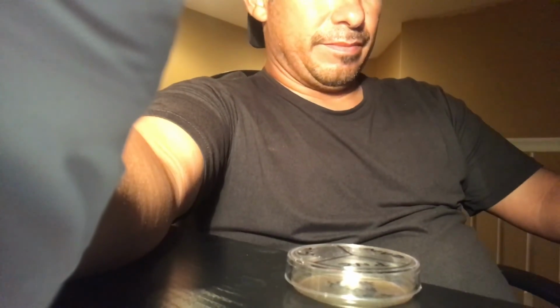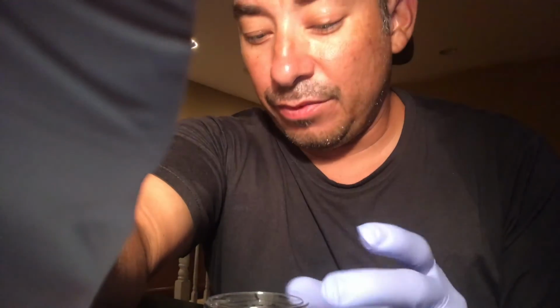So using plastic tweezers helped to transfer the penicillin disc from the bag into the plate. We placed each penicillin tablet in each section. Well, I should say the antibiotic, not penicillin, but each were placed in a section, and that step was repeated for each piece and part of the plate, each zone, I should say. Once this was accomplished, we went ahead and I got this into my incubation area for 48 hours.